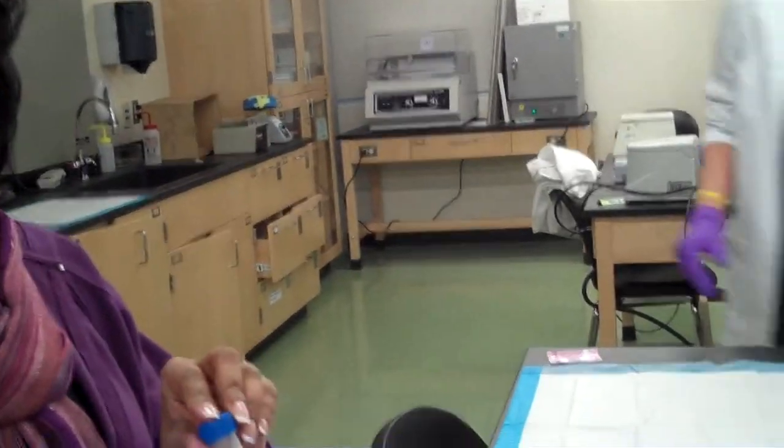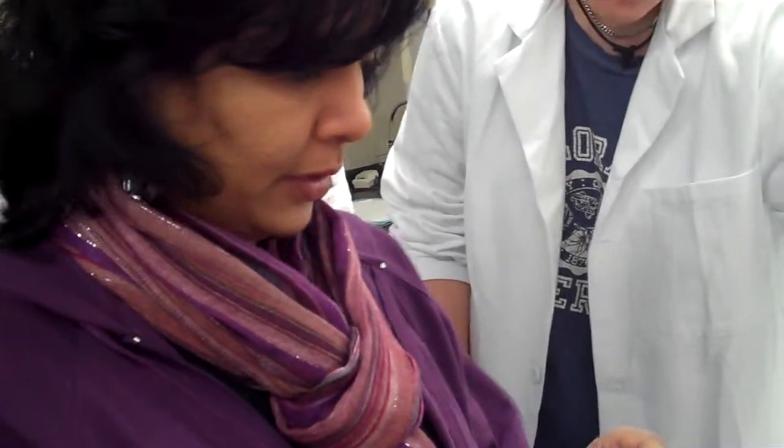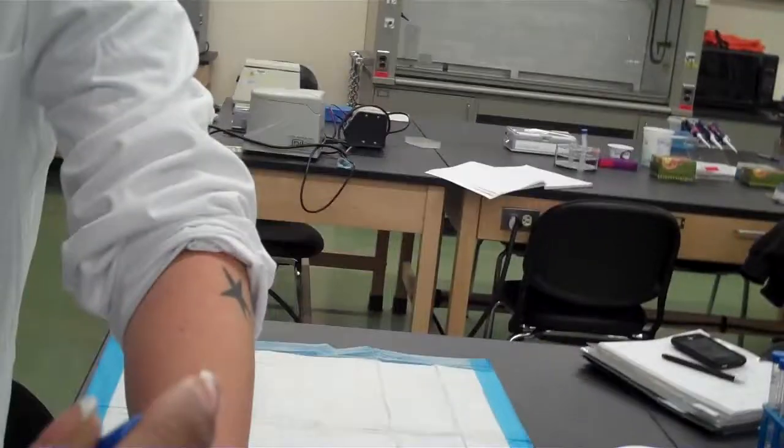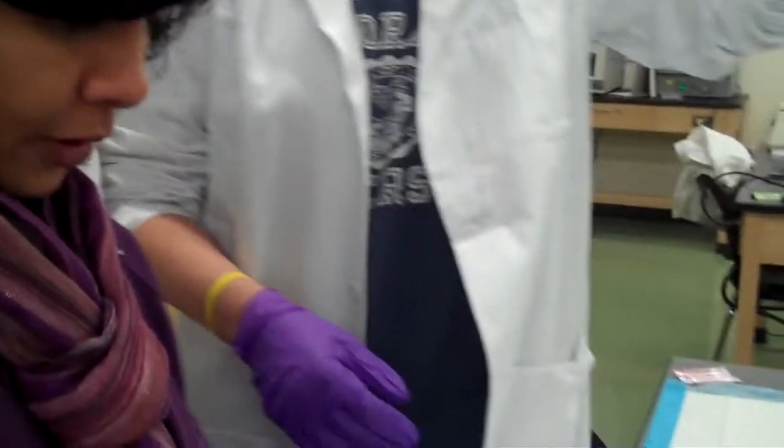Whose tube is this? This has got really good growth. Sean starts with an S. It looks like an M. Oh, that's Sean? Okay, this one looks pretty good. Who's this? That would be mine, I think. Okay, so that one looks good. This one's almost there. You outdid me a little bit. These could grow a little bit longer.